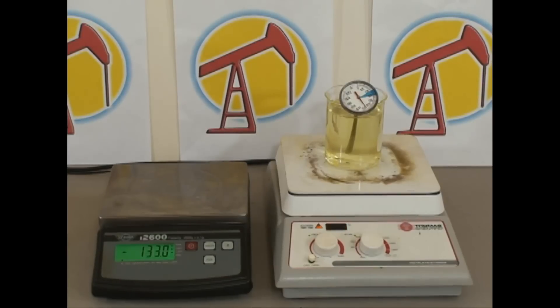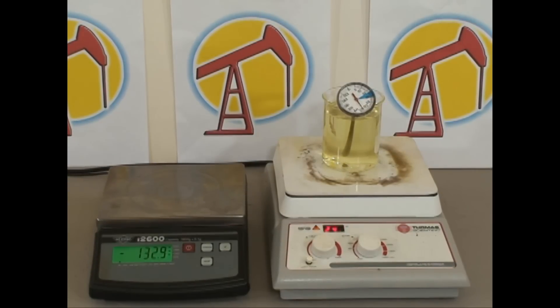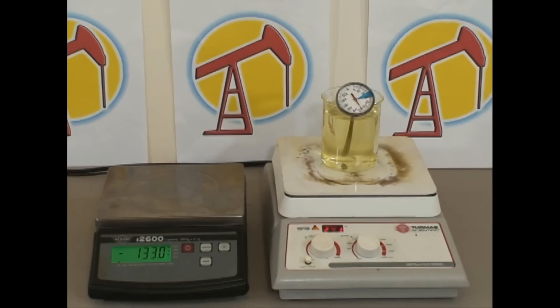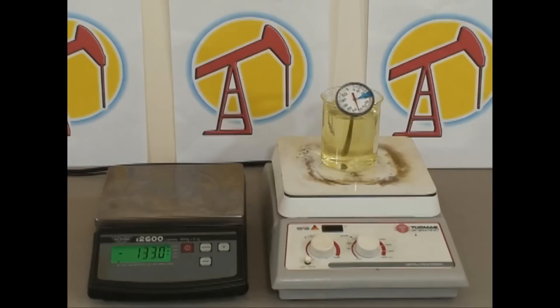I use a hot plate stirrer because I like it. I use it in my biodiesel lab for all kinds of stuff, so I get a lot of use out of it. They are expensive — anywhere from three to five to seven hundred dollars for one like this one. They are budget busters.